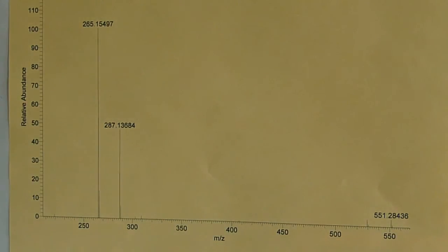Now, high-resolution mass spec data actually gives us some additional information options. We can compare the actual observed data with what the data should be for given theoretical compositions of the molecular species, and thereby we can actually exclude possibilities.